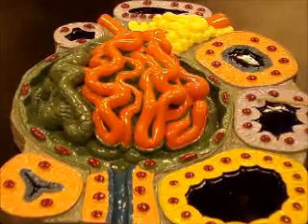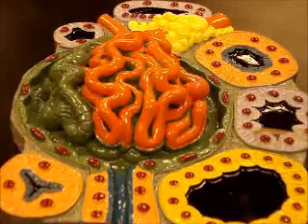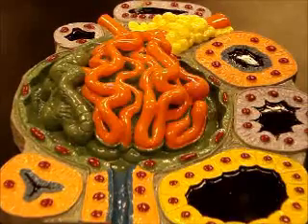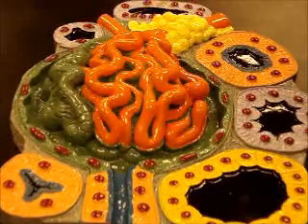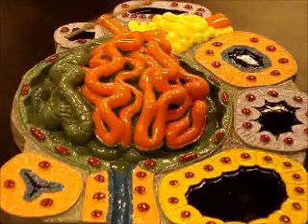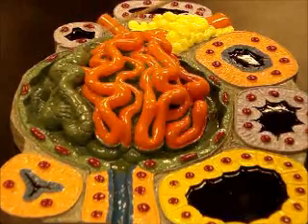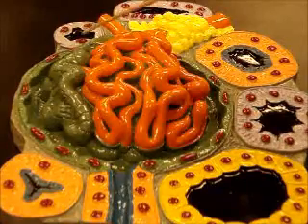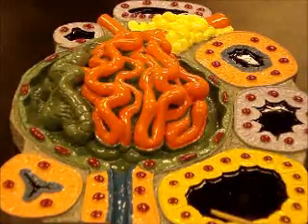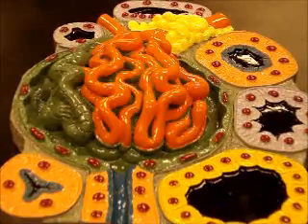This would be part of your distal tubule, cuboidal cells, but no microvilli. As well as this one here is distal tubule, and then you have your macula densa cells here right next to the afferent arteriole. This is your loop of Henle. You can tell because these cells are much flatter, so this is probably thin loop of Henle. And then this is your collecting duct. And that's it.